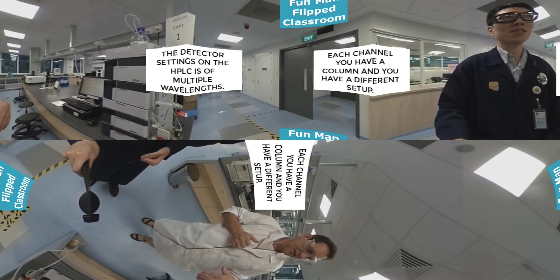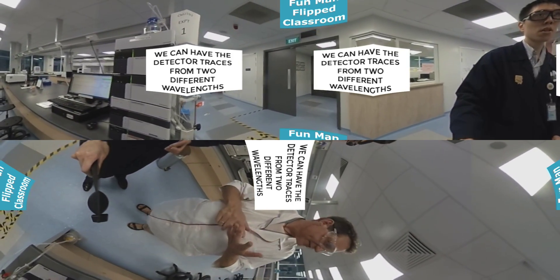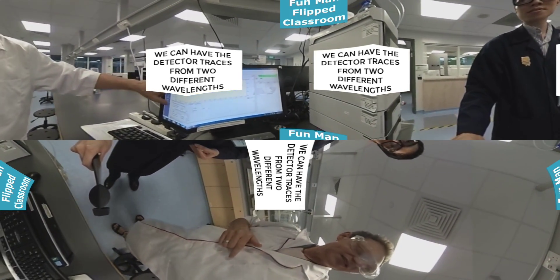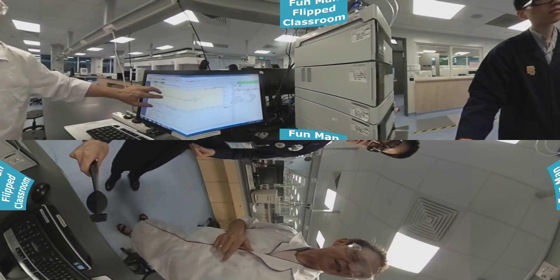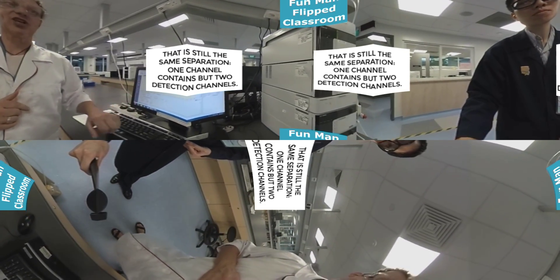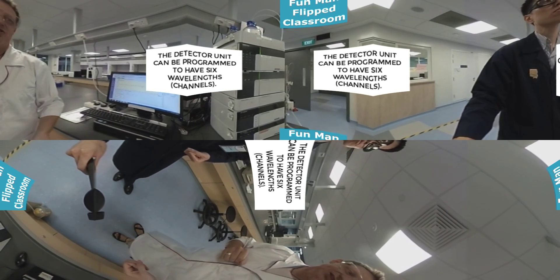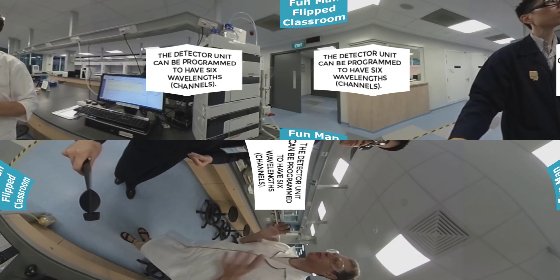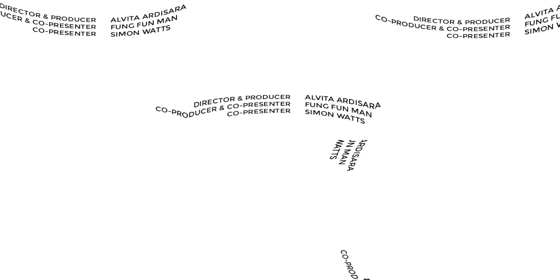The detector settings, which are in here, support multiple wavelengths. So we can have — and this is a good example — detector traces from two different wavelengths here. That's still the same separation, one channel, but two detector channels. From memory, I believe this detector unit can be programmed for something like six wavelengths or channels, but that might be wrong. Thank you for the information.